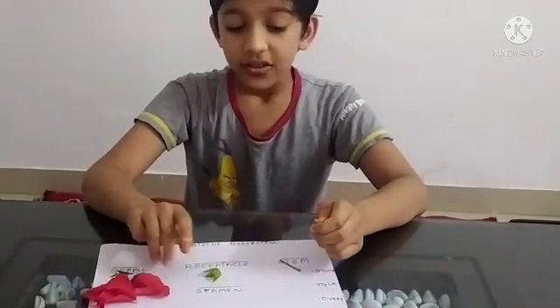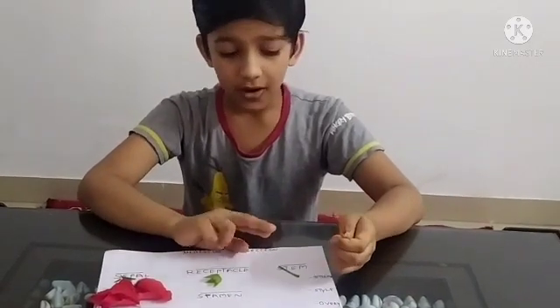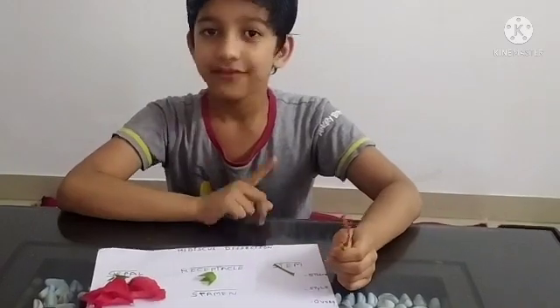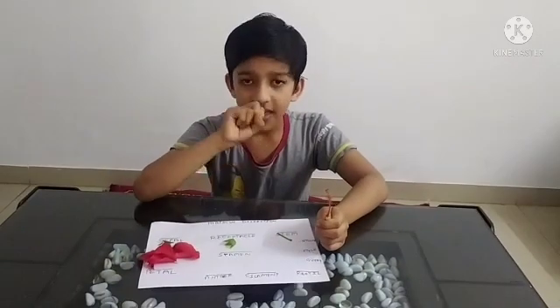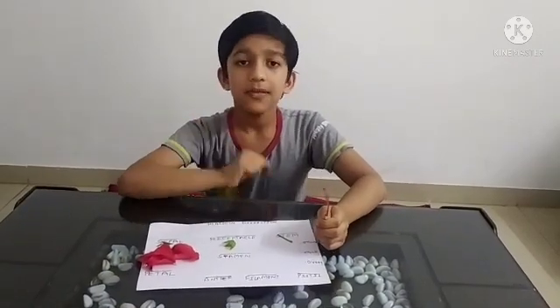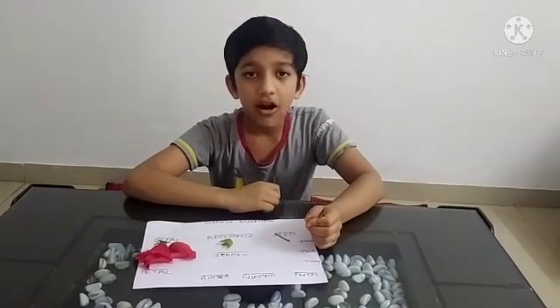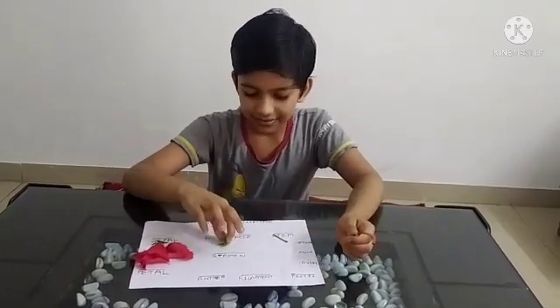Now, if we want our male part, the male parts are the anther and filament. When combined, they are called the stamens.